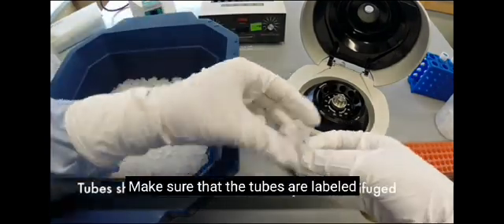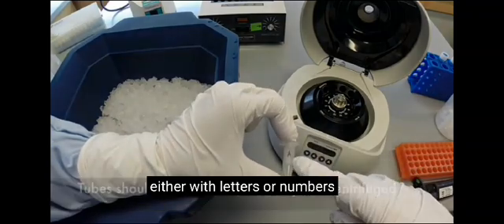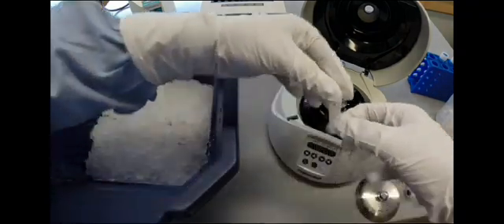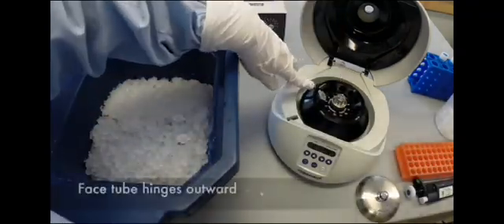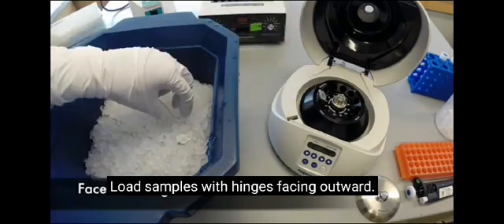Make sure that the tubes are labeled, either with letters or numbers, before loading them into the centrifuge. Load samples with hinges facing outward.